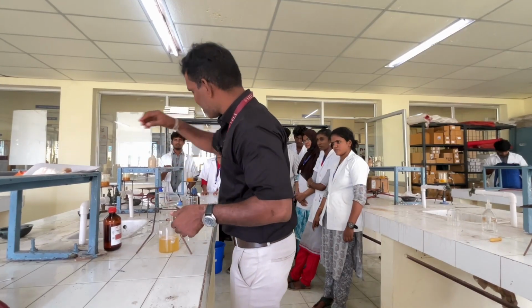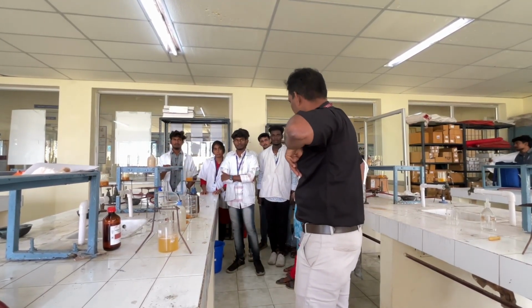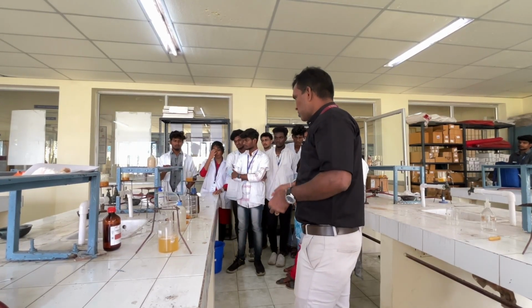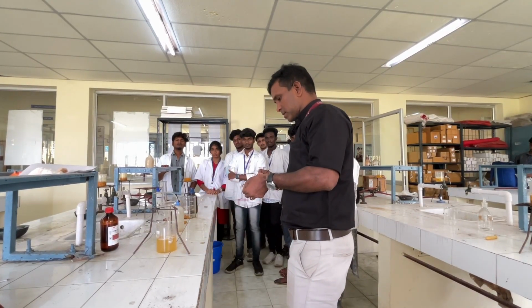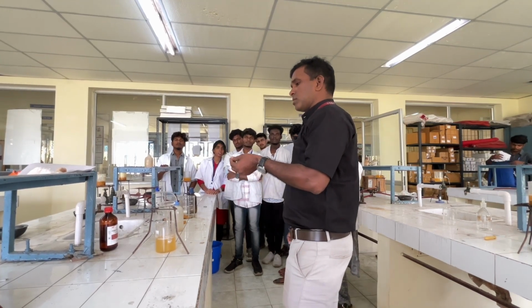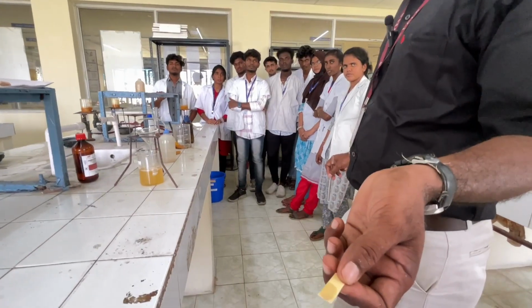So now you will check the pH of the solution. We will check the pH of the solution. Glass rod, glass rod. So now it's a neutral solution.